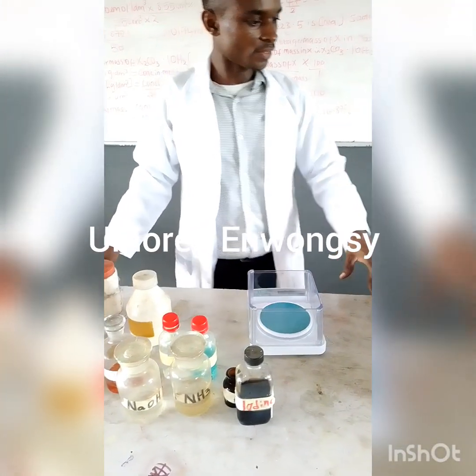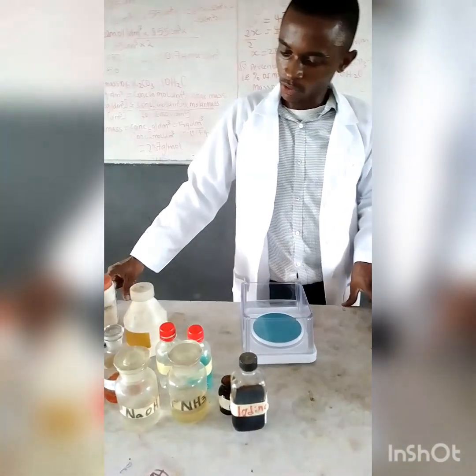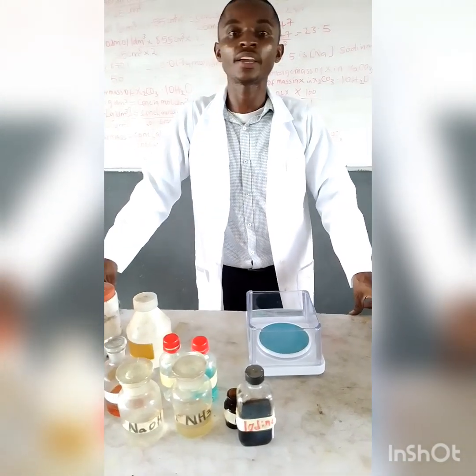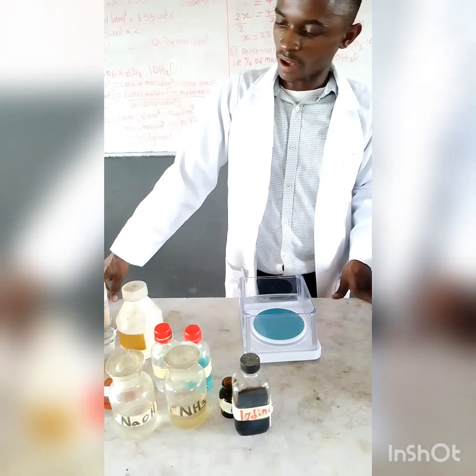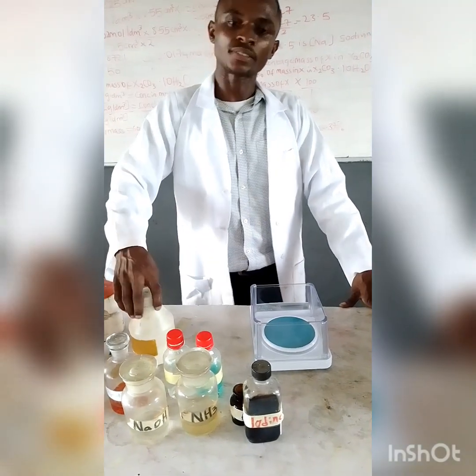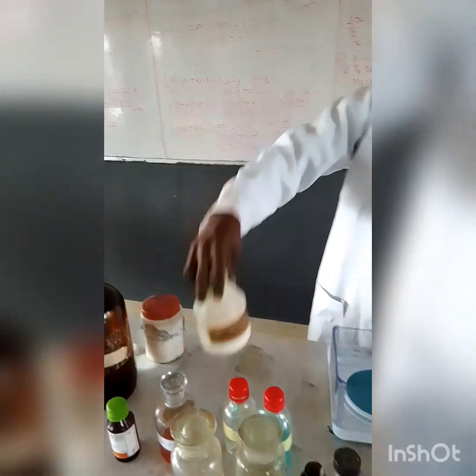So another part of our preparation toward this WAEC chemistry practical. Now here we want to look at how we can actually prepare most of the reagents that are needed for the success of this WAEC chemistry practical. Okay, we are asked to prepare 5 grams of the base, which is sodium trioxocarbonate(IV) decahydrate.